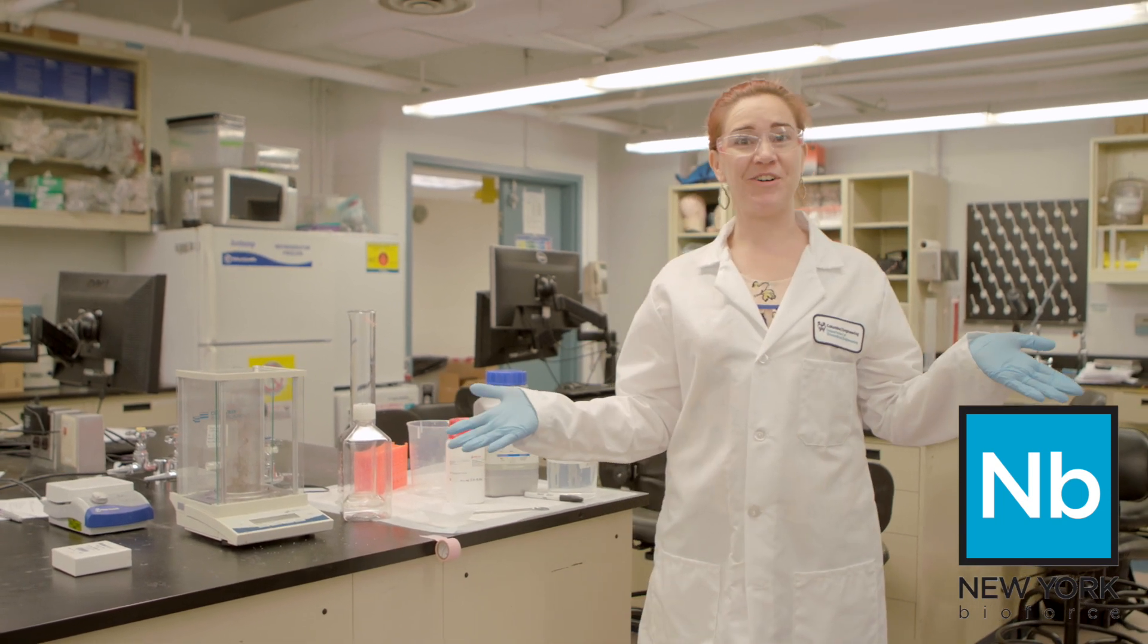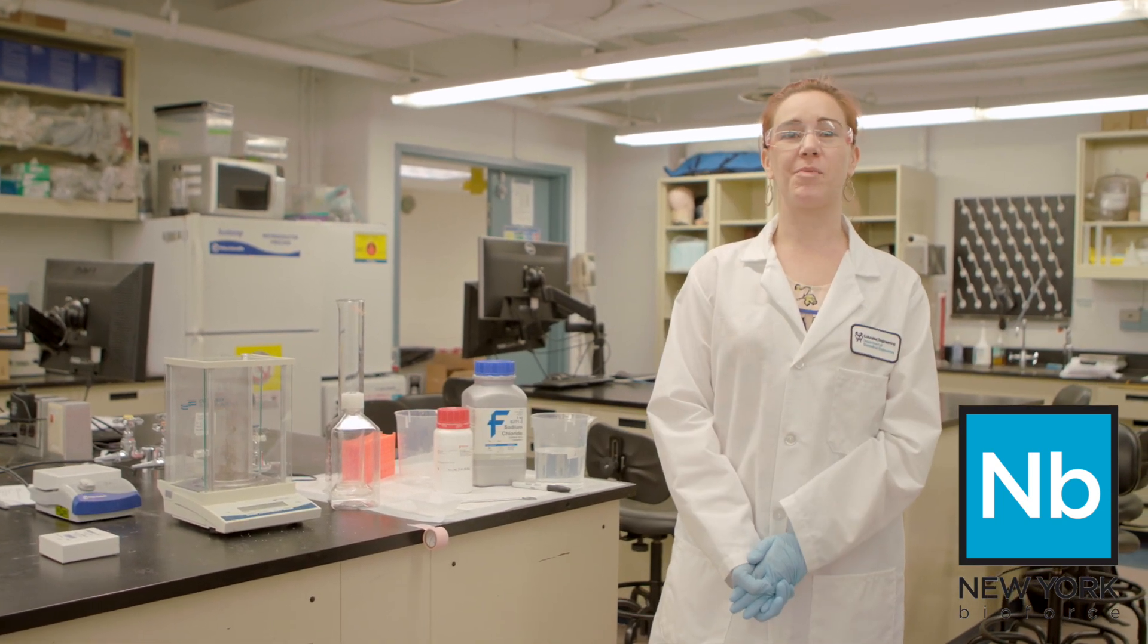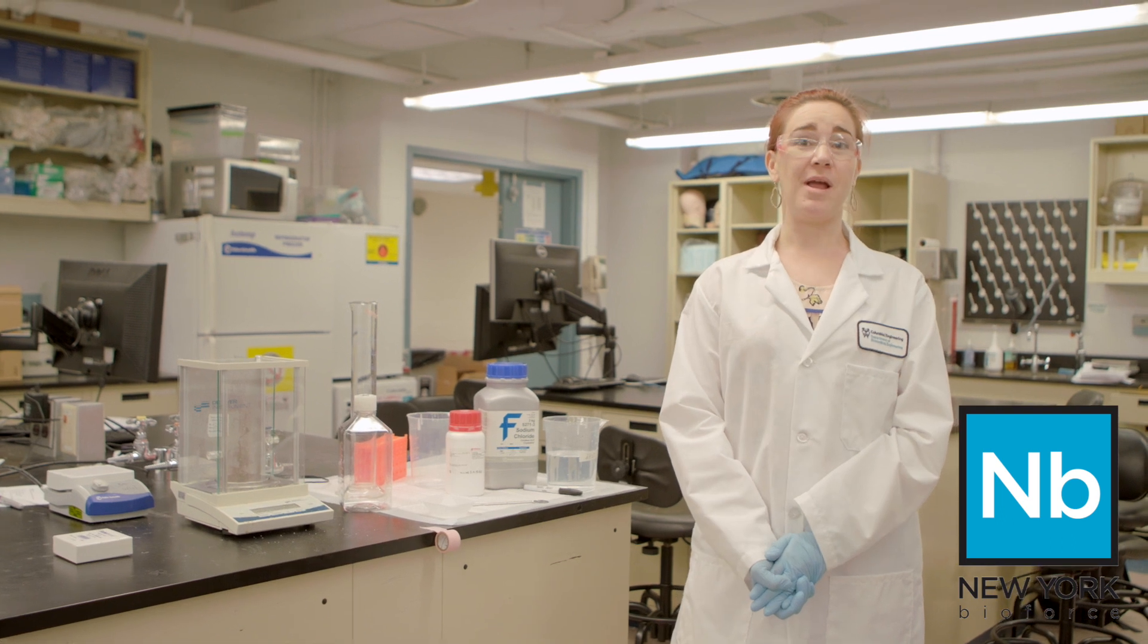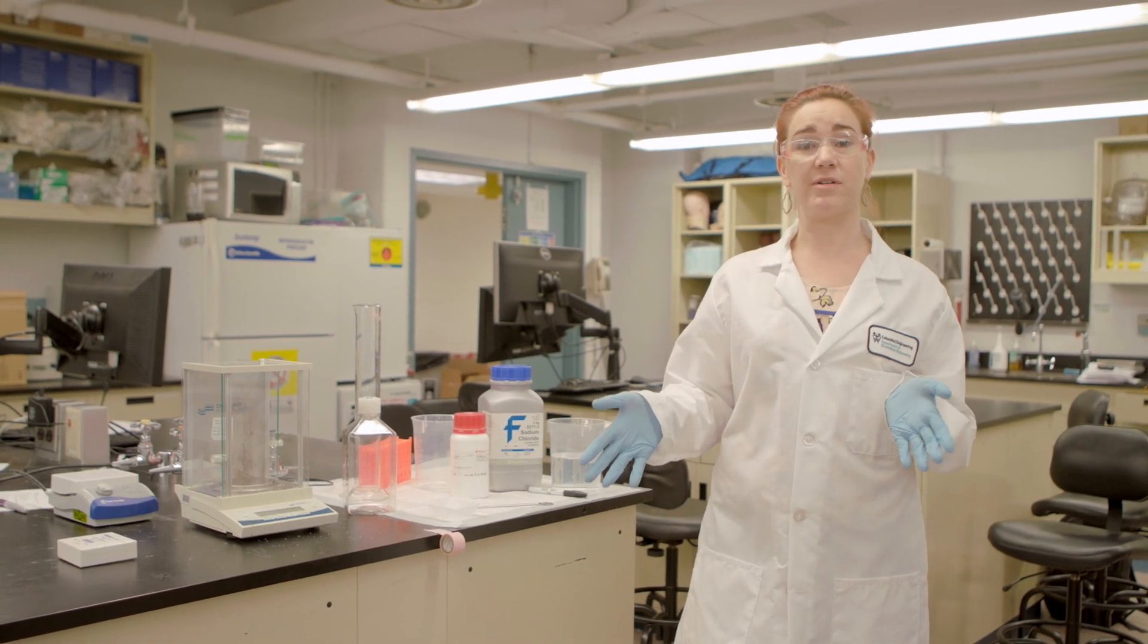Hi, my name is Rachel and on behalf of New York BioForce, I'm going to go over making a basic buffered solution.